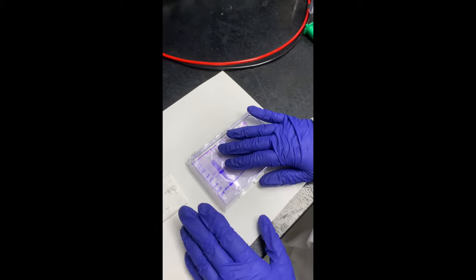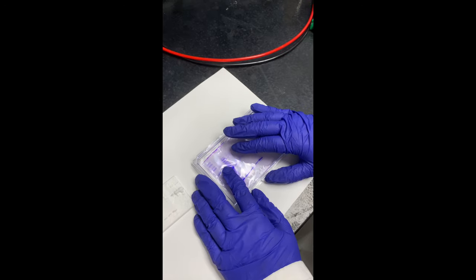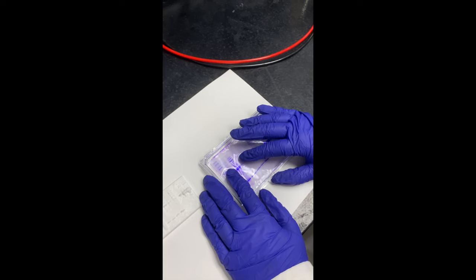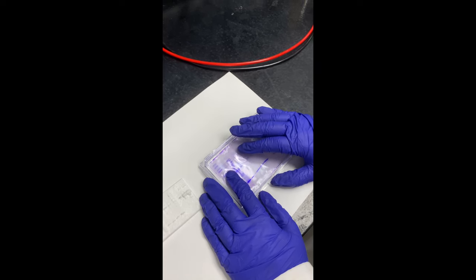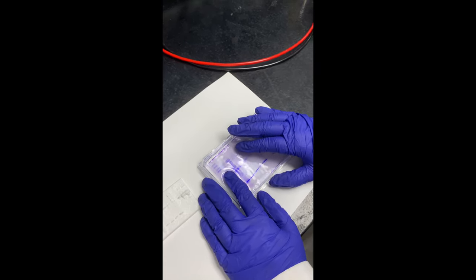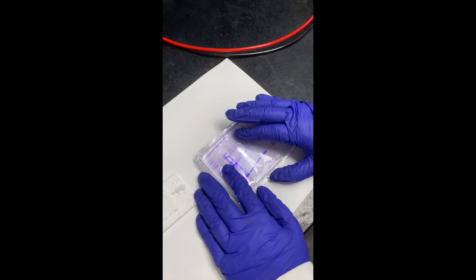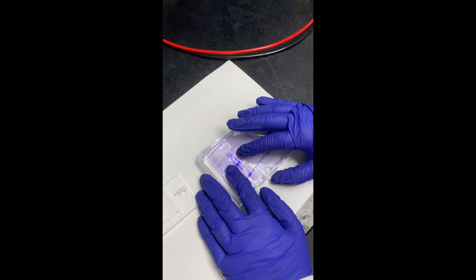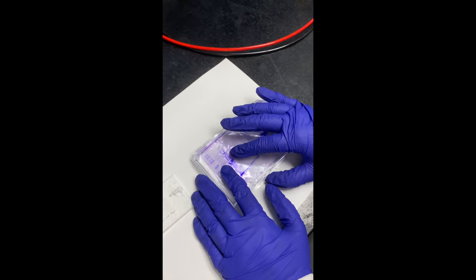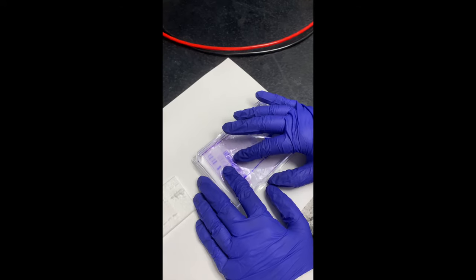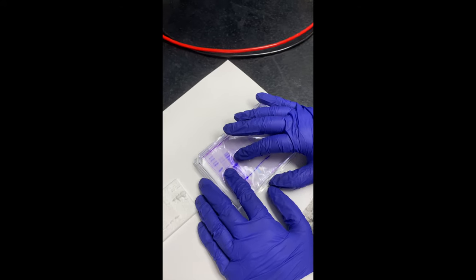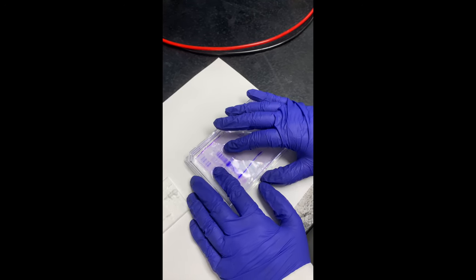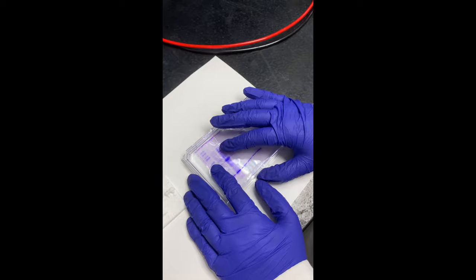So that is here. How would you describe that? Like really thin, kind of like jello. No, thinner than gel. It's like thicker than paper but it's super stringy, kind of breakable, fragile. And right now it's sitting in water to keep it hydrated. It's very smooth even though it's super porous. The pores are really tiny so we can't even see or feel them. It's just so smooth and thin, just a layer of stuff.